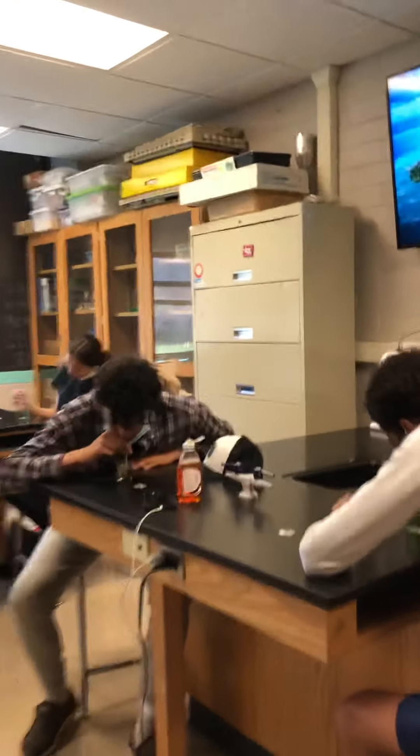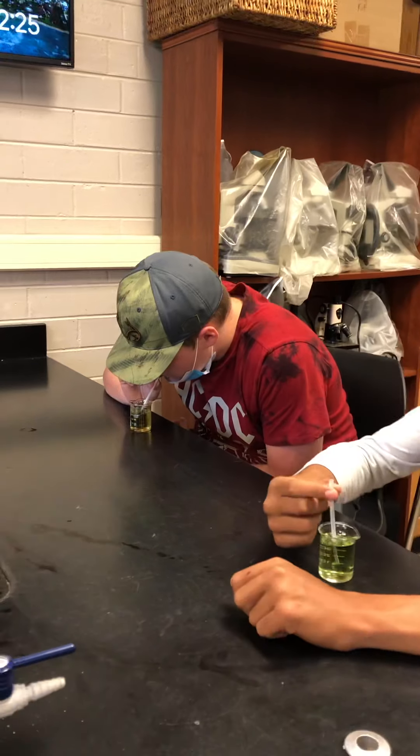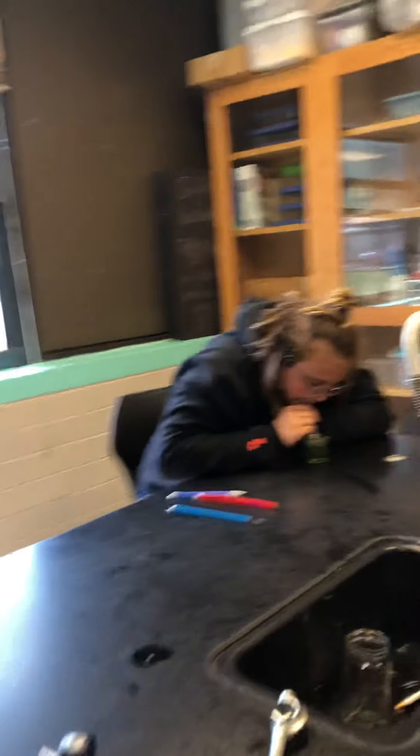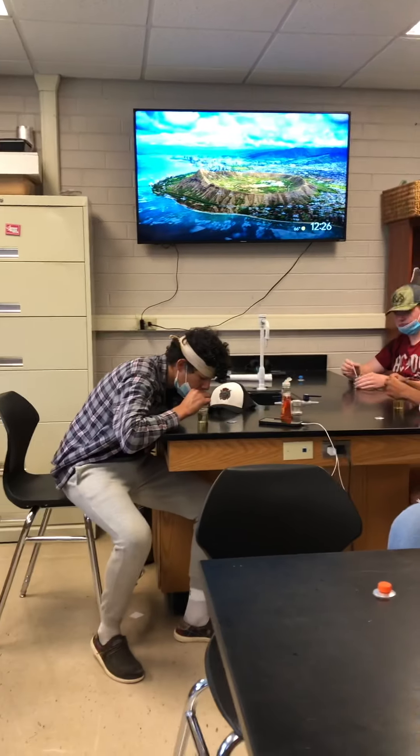Mine's already changed — see, while I was sitting there talking yours was already changing. Mine's changed too. Oh yeah, yours is changing. Once it gets yellow you can stop. That's a pink one — yellow. Is everybody's changing? Can I do it again?